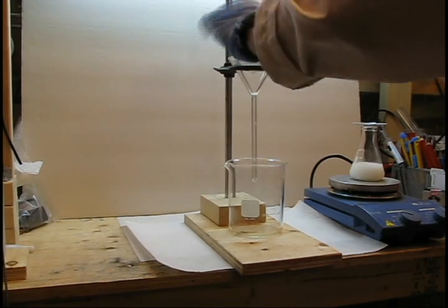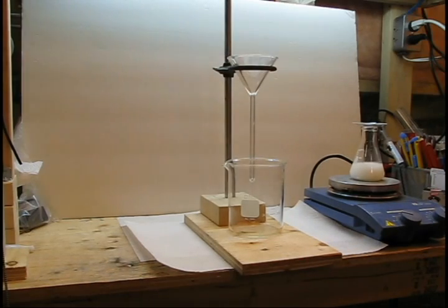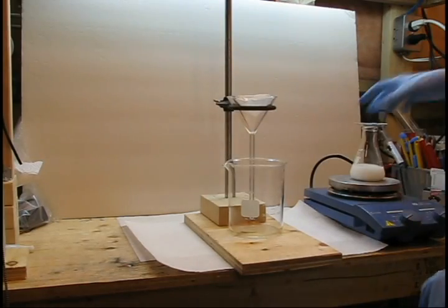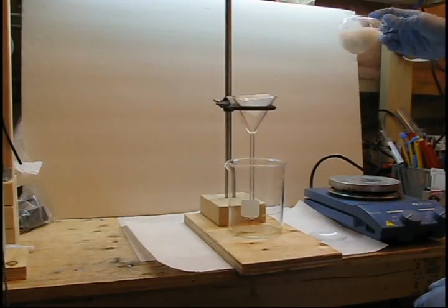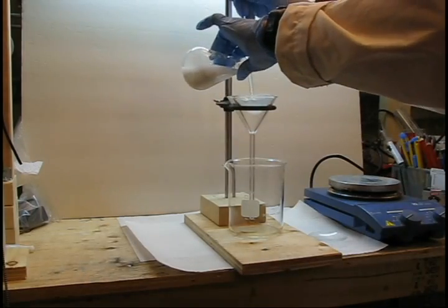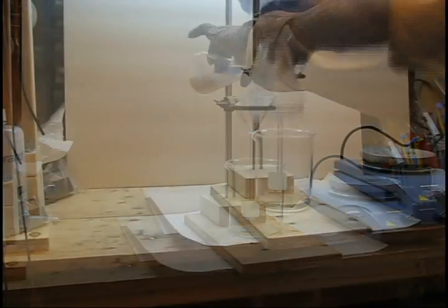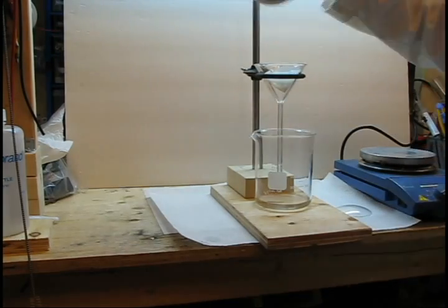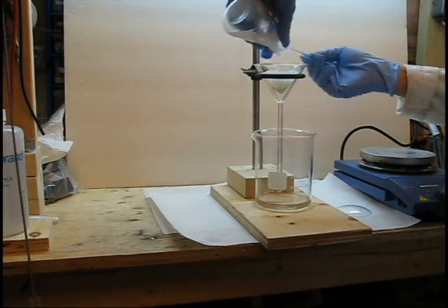Here I will demonstrate gravity filtration, but if possible use vacuum filtration for speed. Set up your filter funnel with filter paper in a ring clamp, and then filter the isopropanol solution by gravity. You can use a magnet to hold the magnetic stir bar in the flask as you empty the solids into the filter paper.